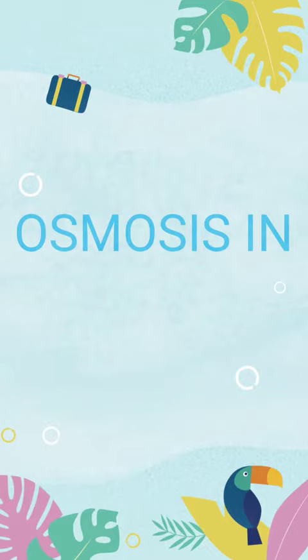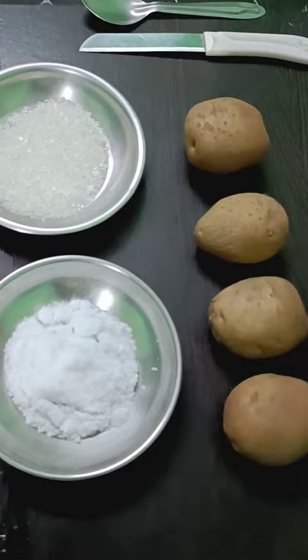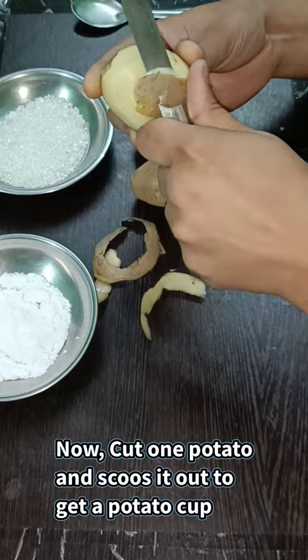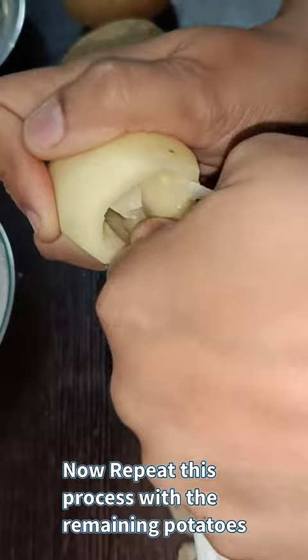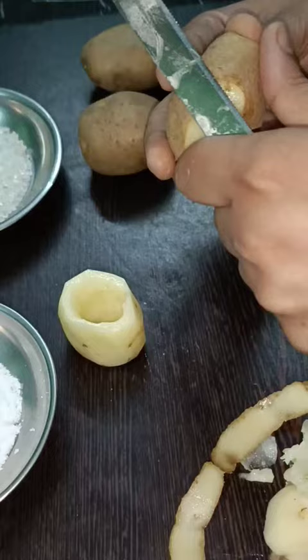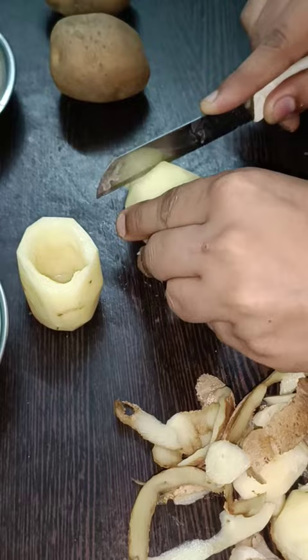So let's start. Firstly, take 4 potatoes and some sugar and salt kept in a small plate. Now cut one potato and scoop it out to get a potato cup. Repeat this process with the remaining potatoes until 4 potato cups are obtained.